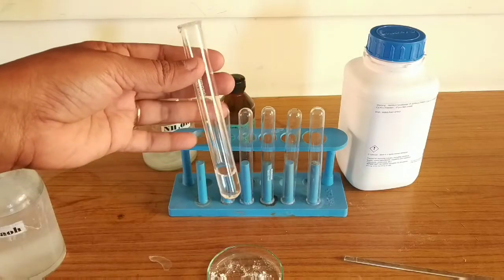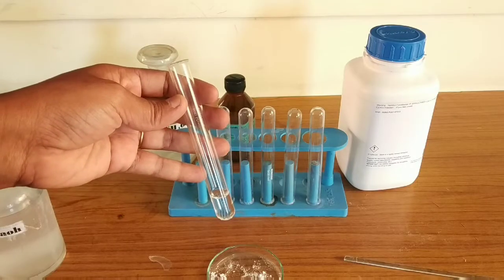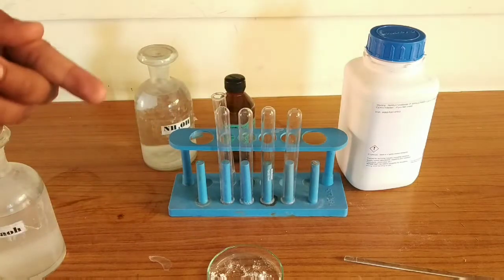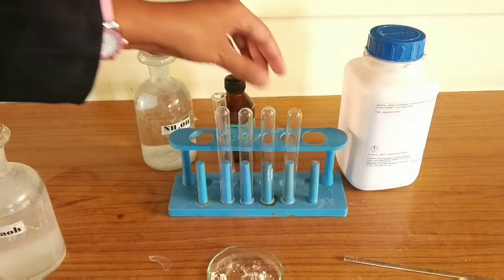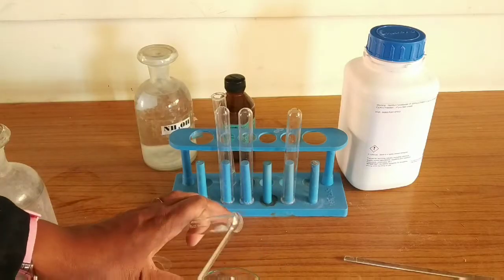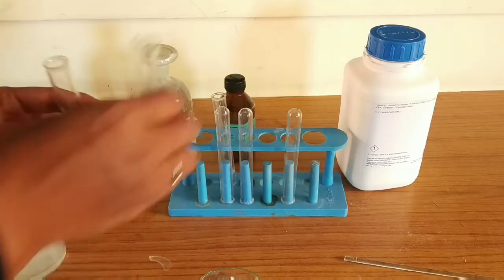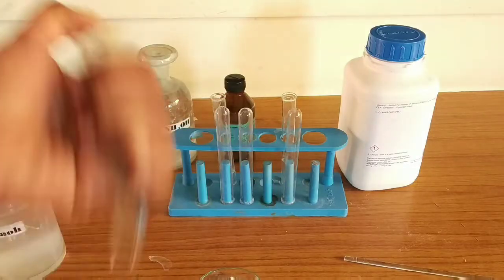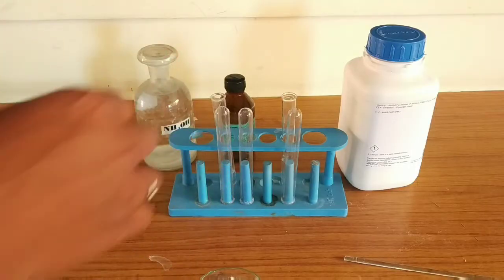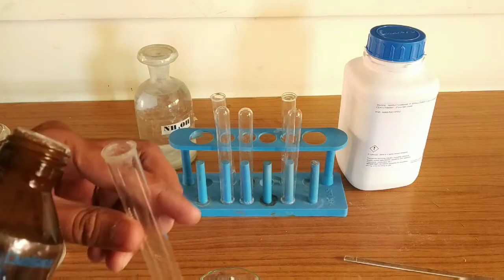That was the indicator test for ammonia gas. Now I will show you the confirmatory test. For this, you need to make a salt solution: take a very small quantity of salt in another test tube, pour water into it, and mix it properly until the salt dissolves.